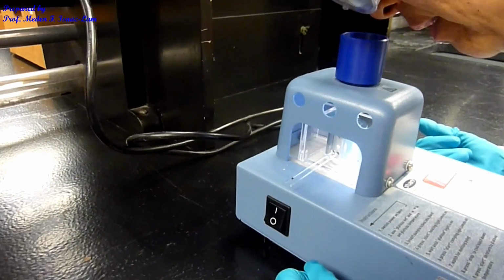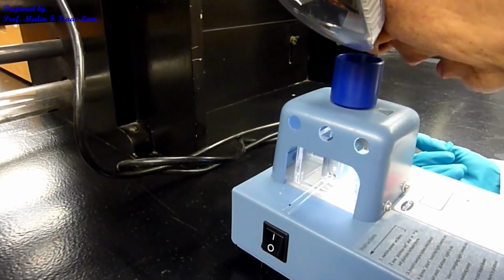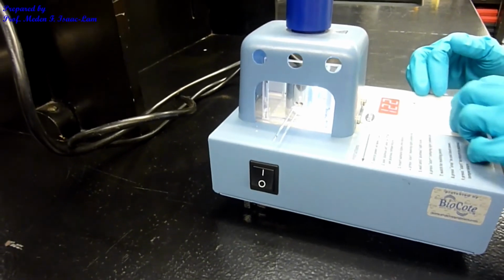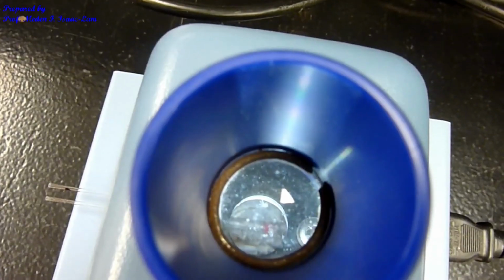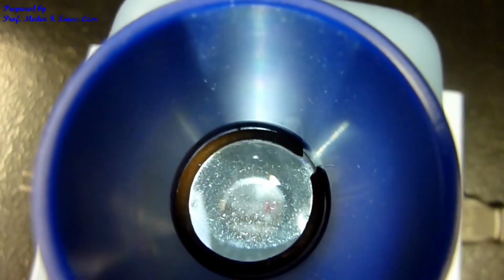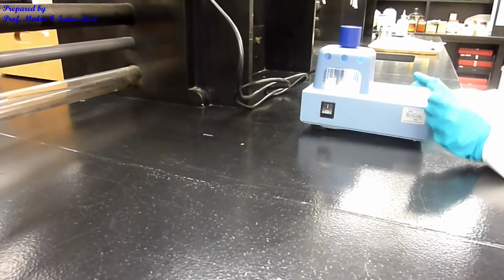To melt the impure sample, about 113 to 120, and the sample, increase it to 124, and you can see that the top one became pink. So the sample already melted.